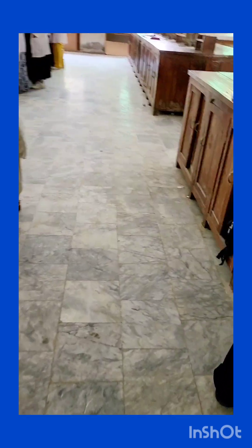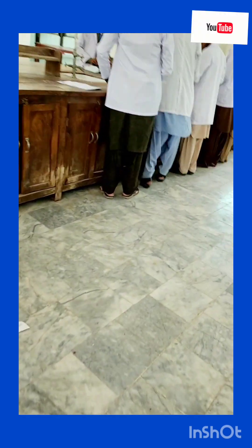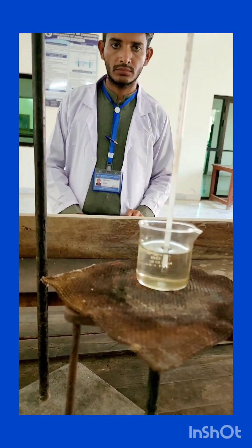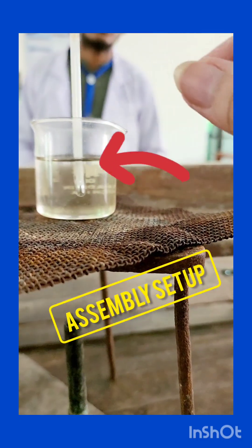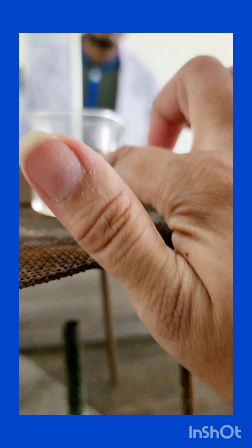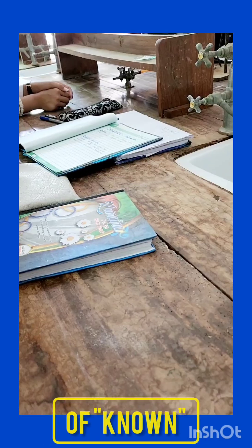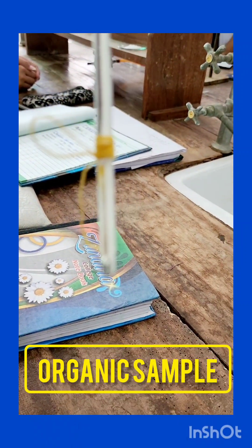The first experimental day is going very fine — that's great. Everybody is trying to catch the things; the instructions are being followed, which is very nice. The thermometer is just hanging in the middle of the paraffin oil, not touching the sides — just in the middle. That's great.